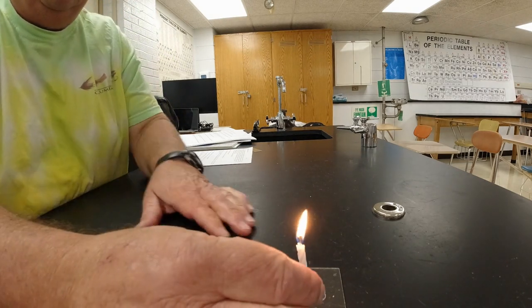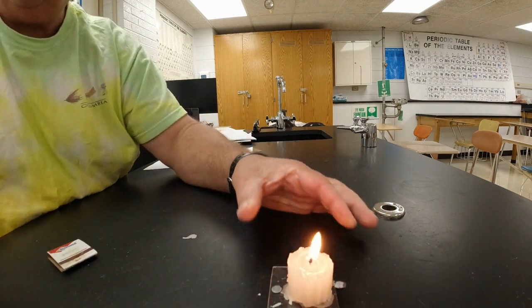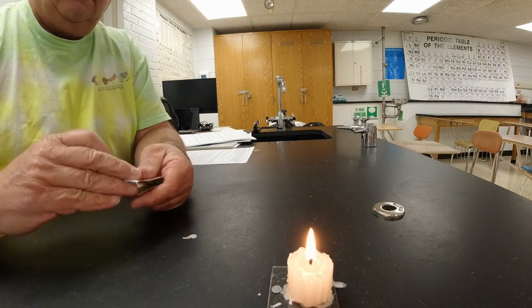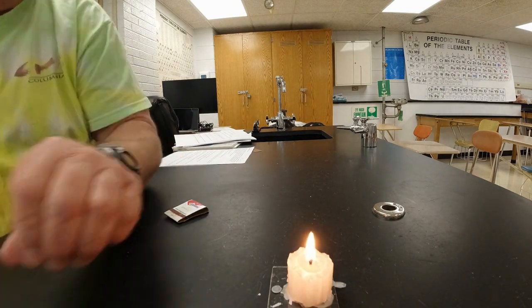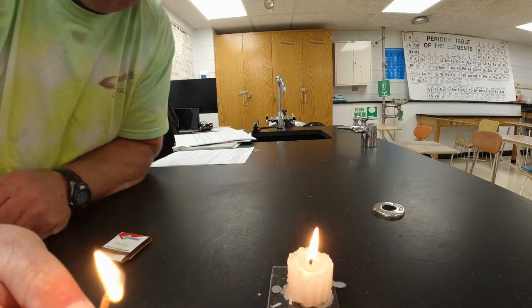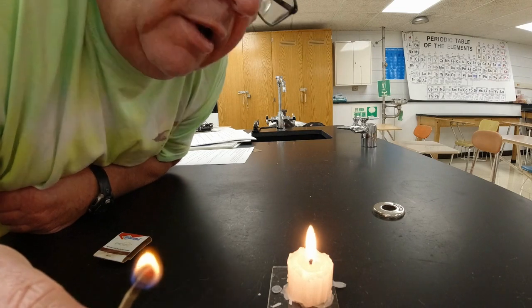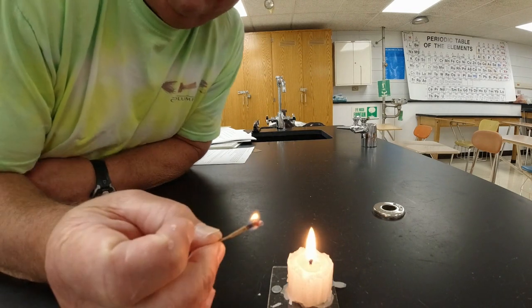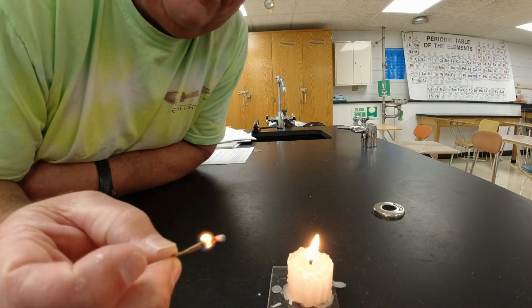All right, so now we're going to try this again. We've let this other candle burn for a while, and we'll see if we can't get this to work a little bit better again here. All right, so here's my candle. It has been burning pretty good here. I'm going to blow it out. I'm going to put the flame from a match in the smoke above it. Now, that worked pretty good that time. I don't know if you guys saw it, but we'll try it again. And there, I didn't touch the wick, all right?